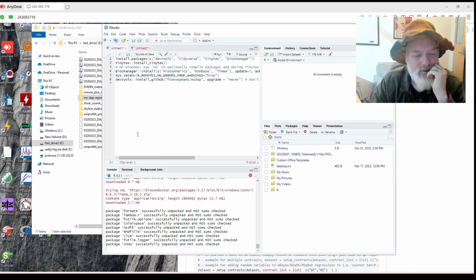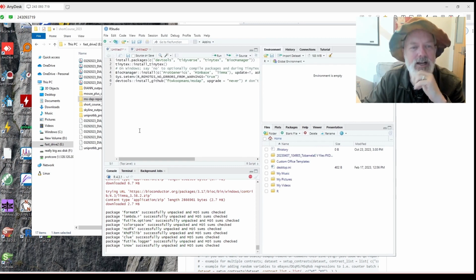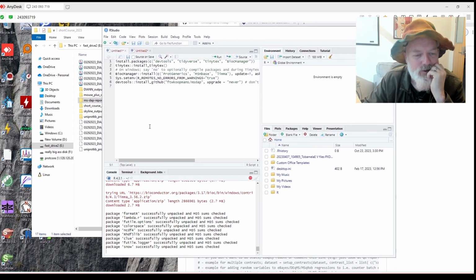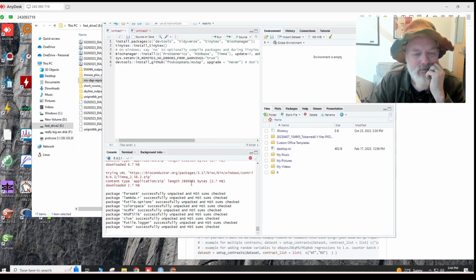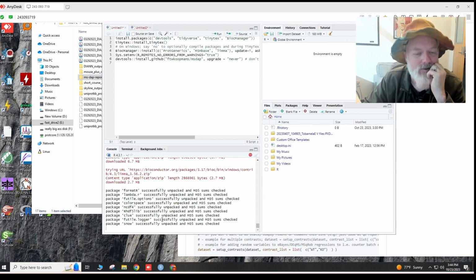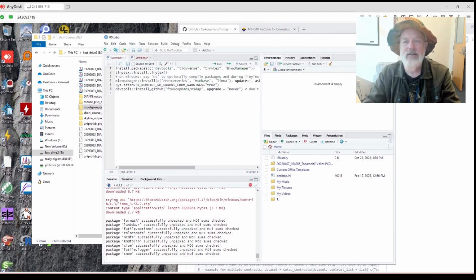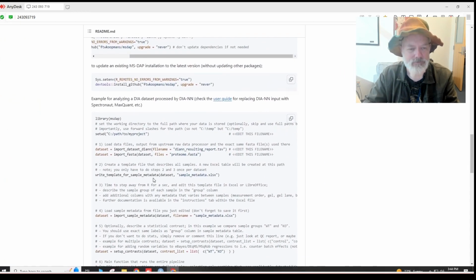And I wanted to do this with you in real time because I wanted to show you some of the problems I usually have with RStudio. And hopefully that'll help you troubleshoot it, because I usually have a lot of problems with it. Okay. Lambda R, format R, color space. All right. Okay, so while it's doing that, let me show you some other tricks about MSDAP.